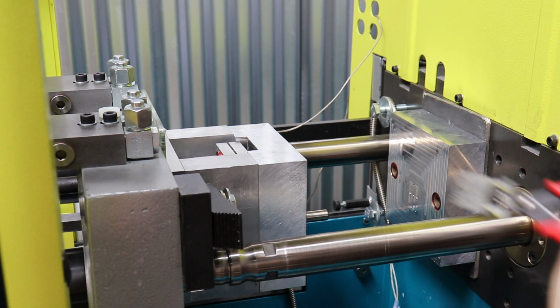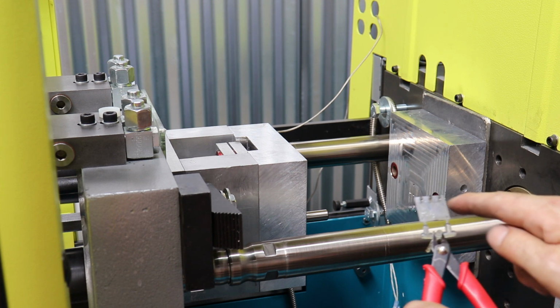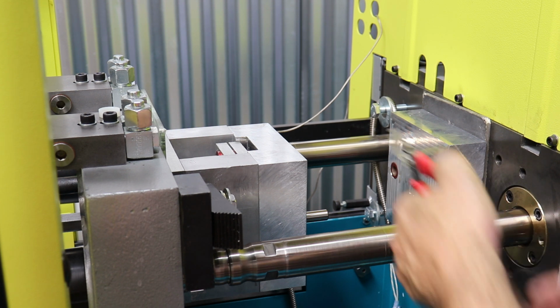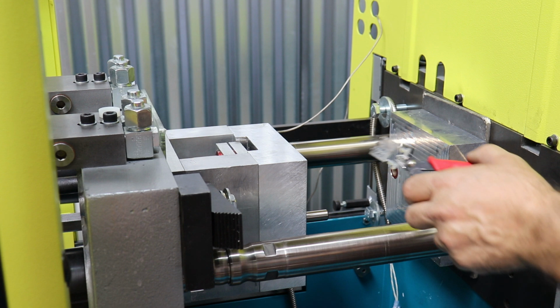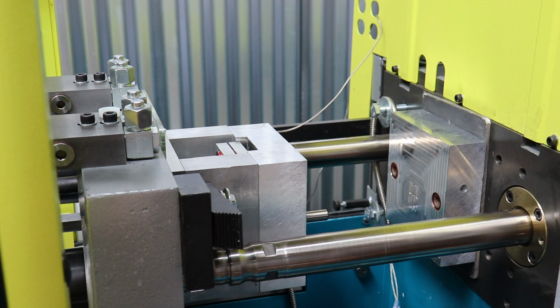But that actually popped out real easy. So here's our first funky part with all of the machining oil on it and everything. But actually that doesn't look bad at all. And the part actually popped out very easily. So what I'm going to do now is probably just put a couple detents in the runner on the B side, and we'll see if that fixes the problem.